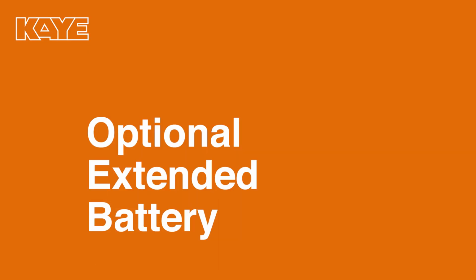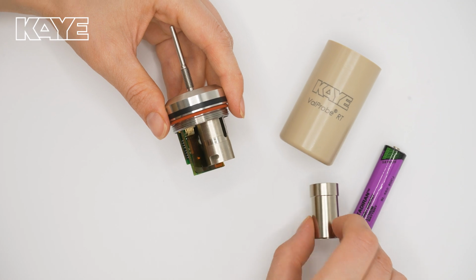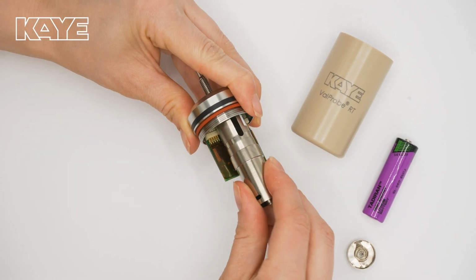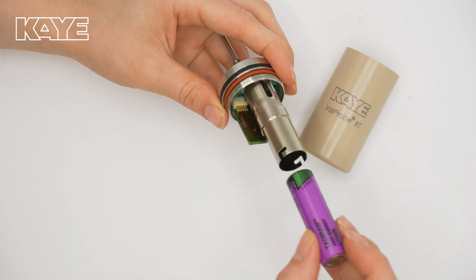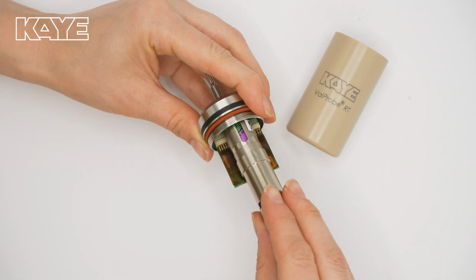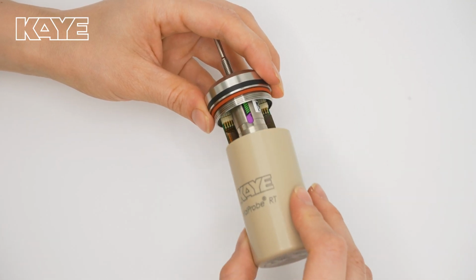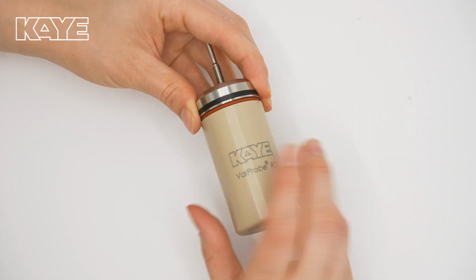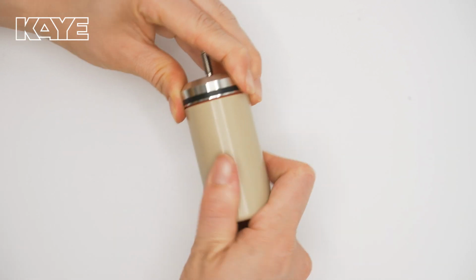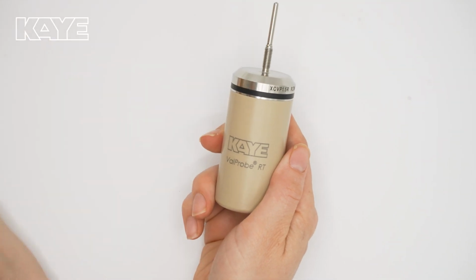When working in extremely cold conditions, we recommend using an extended battery. First, you'll need to attach an extended battery housing by lining it up with the grooves on the ValProbe and twisting it clockwise. Insert the new battery with the positive end going in first, then attach the spring-loaded battery cap by lining it up, pushing in gently, and twisting it clockwise. Finally, twist on the housing unit, making sure it's snug and the O-ring is no longer visible. Always hand tighten. You don't need any tools to do this process.